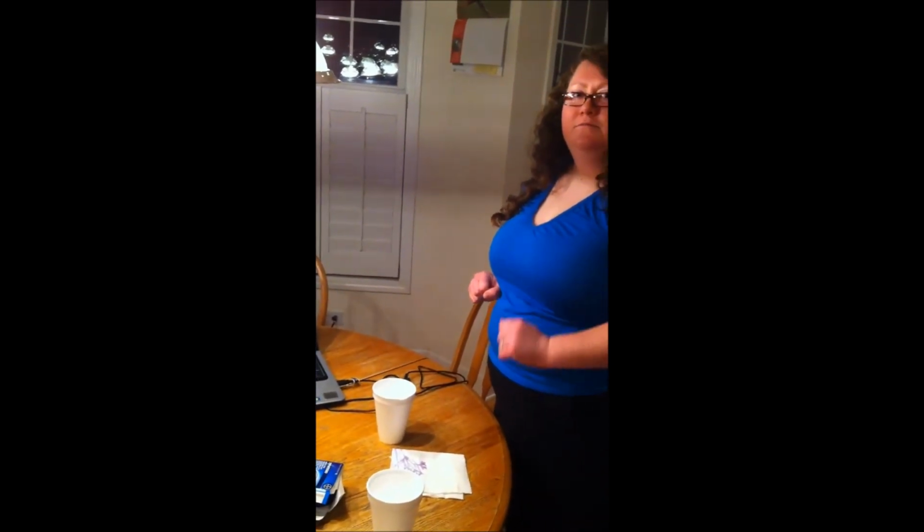What reaction time did you guys get when you used the about 60-degree water yesterday in lab, Debbie? About 36. 36. All right, so it's really close, right? Yes. Okay, good. So what have we learned today? We learned that the increase in temperature of the solution that the Alka-Seltzer is being dissolved in increases the reaction rate and decreases the time it takes to consume. Okay, and what did we learn about this being endothermic or exothermic? Dave? We again learned that it's an endothermic reaction no matter whether it's at room temperature or elevated temperature of the water.